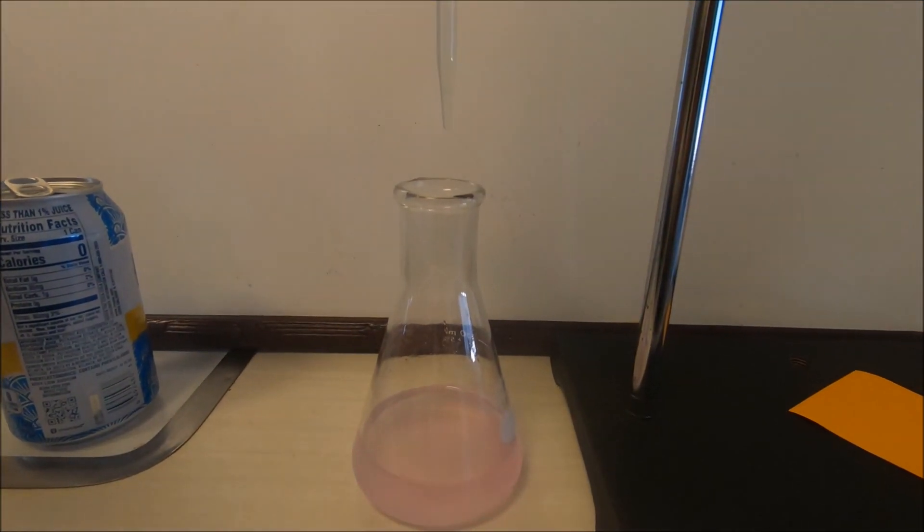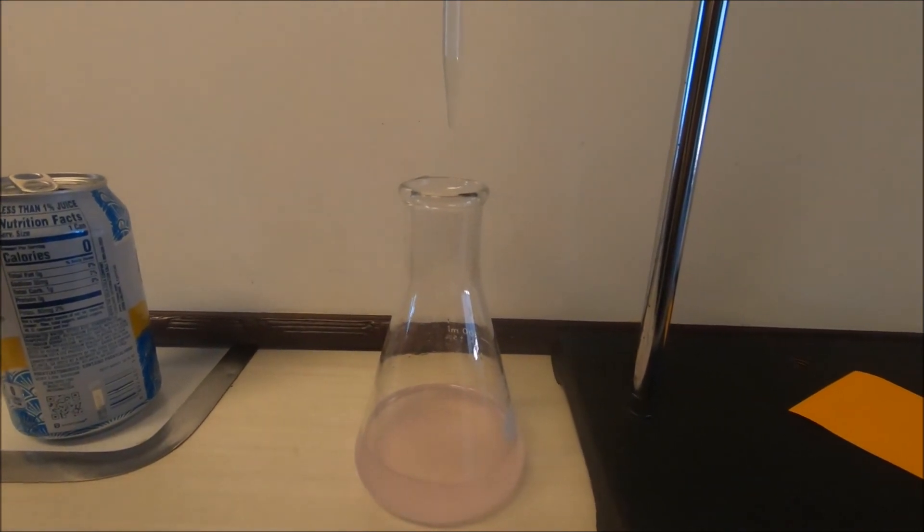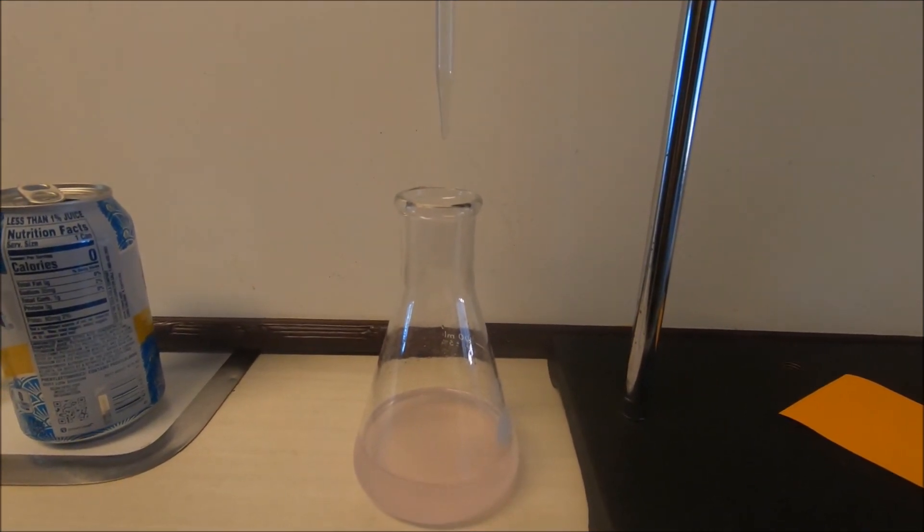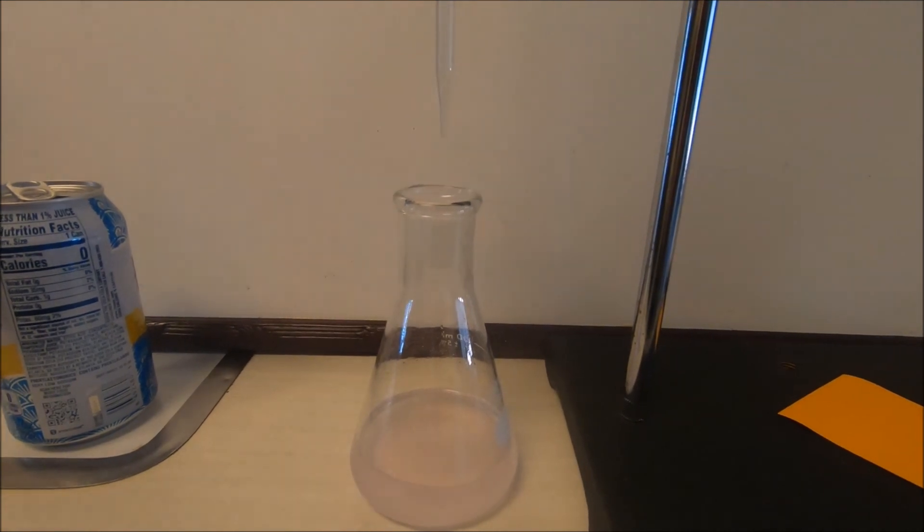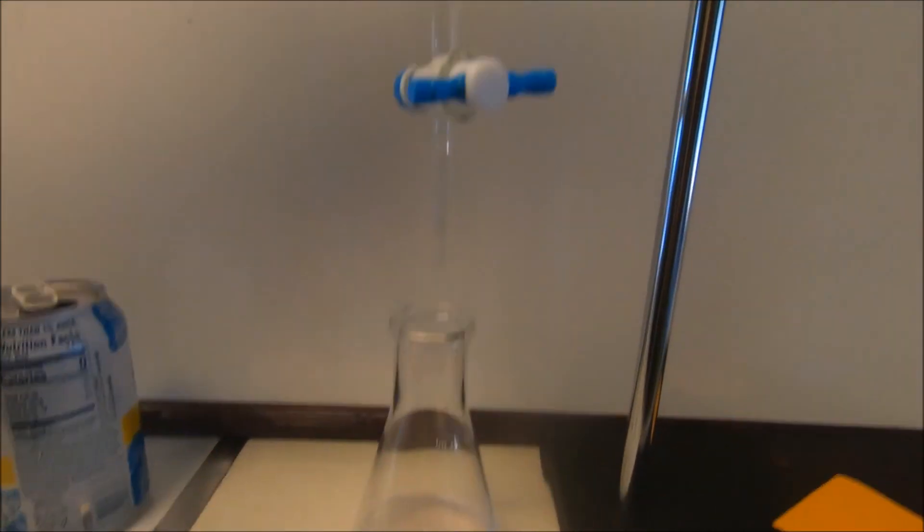Showing now that we've hit that equivalence point where the base and the acid are neutralized, showing that indicator helping us out there. Our final volume now to look is we are at close to that 60 mark.